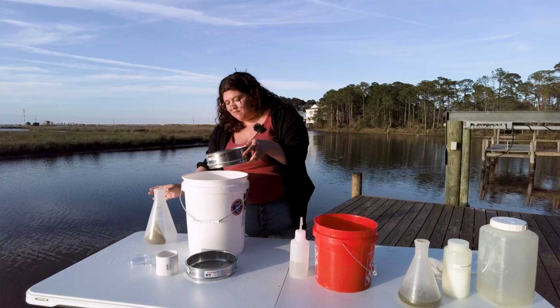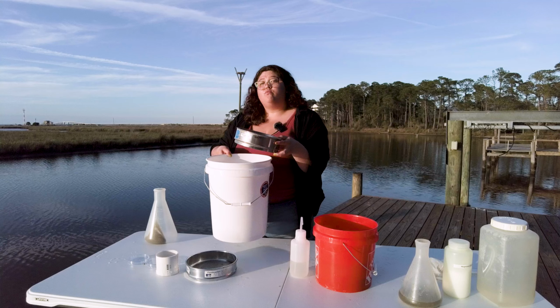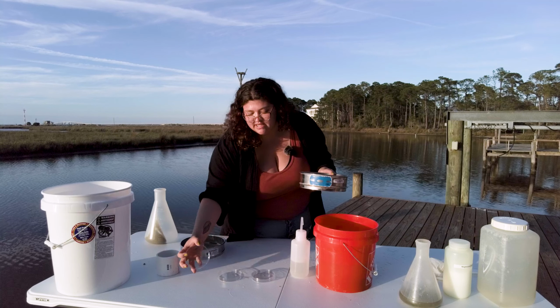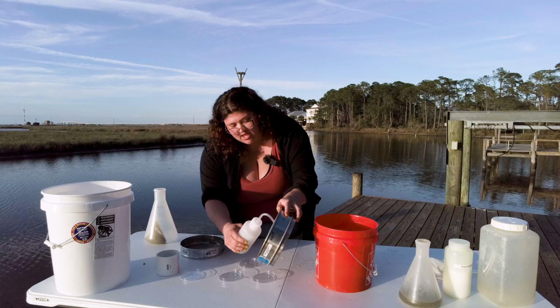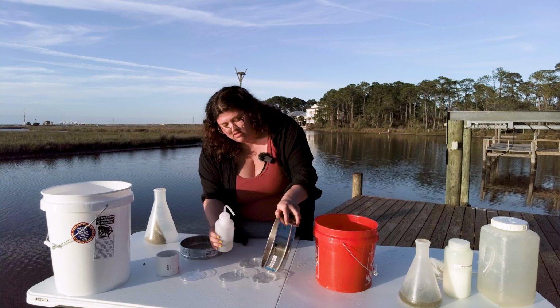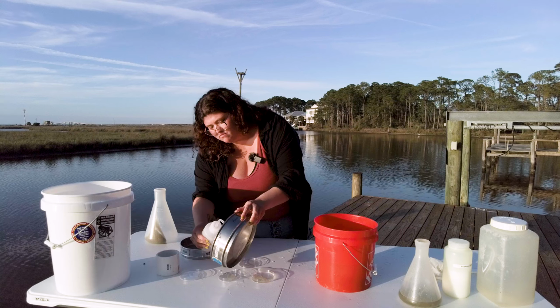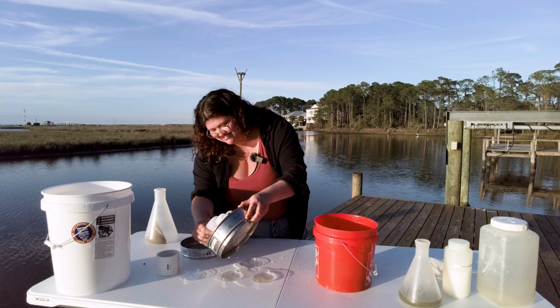You can actually keep this magnesium chloride that you run through, we can call it a dirty mag chloride bucket, and reuse it for multiple extractions. Then we have our Petri dishes where we're gonna keep our samples and a squeezy water bottle. You squeeze the water on the inside of the sieve and get out what we sieved through. It can be a little bit messy.